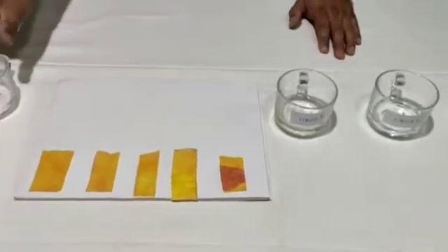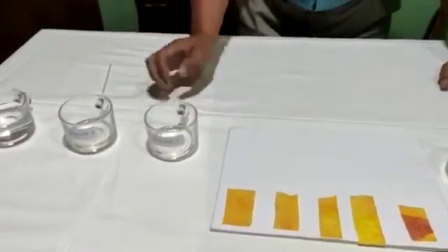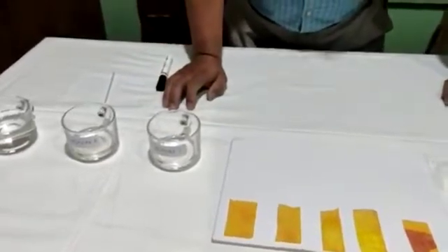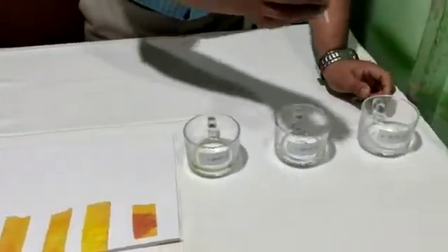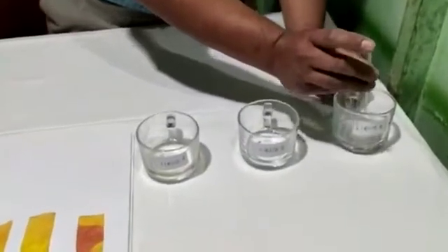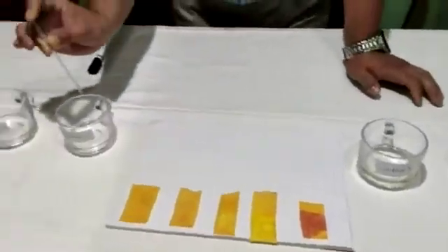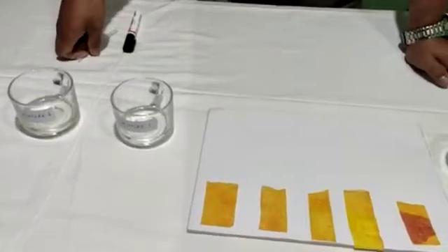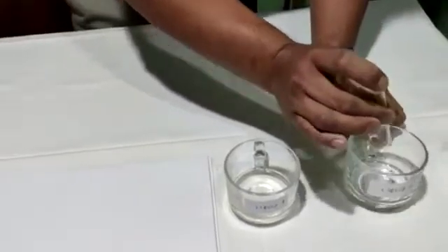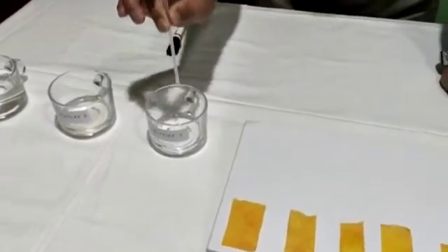For that, we need to make two different mixtures. I label this beaker mixture 1 and this one mixture 2. Now let us make mixture 1. For that, we need to take one drop from liquid 1 — which we have already confirmed is a basic solution — and put it in the mixture 1 beaker. Now let us take one more drop from liquid 2 and mix it in the mixture 1 beaker, because we are making a mixture of two different liquids.